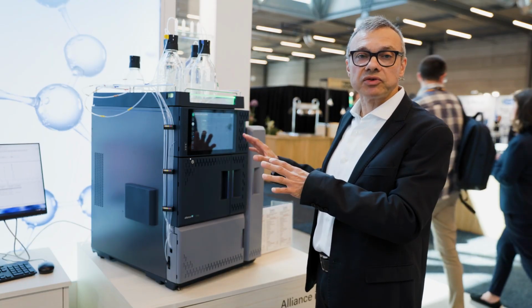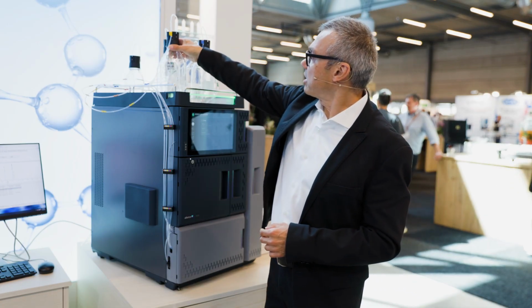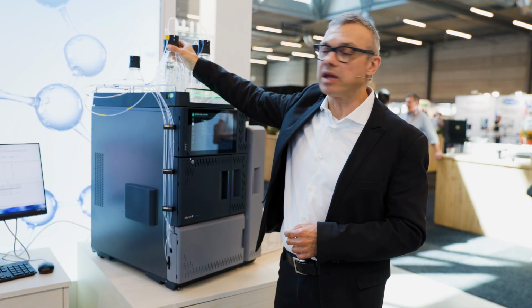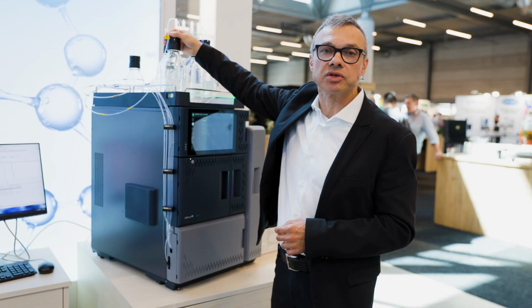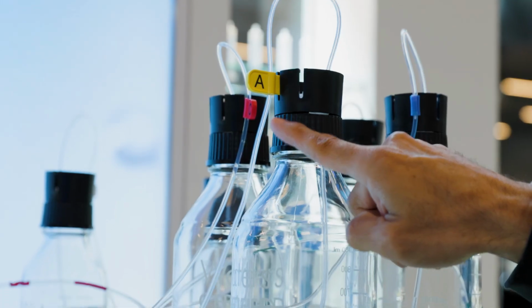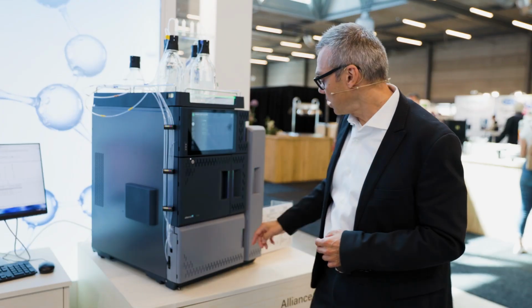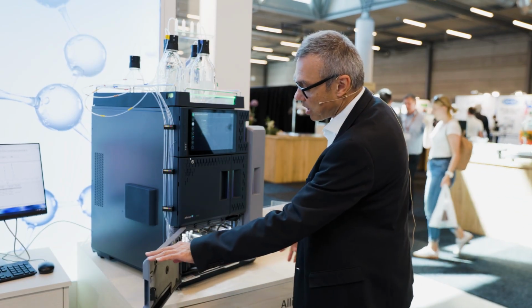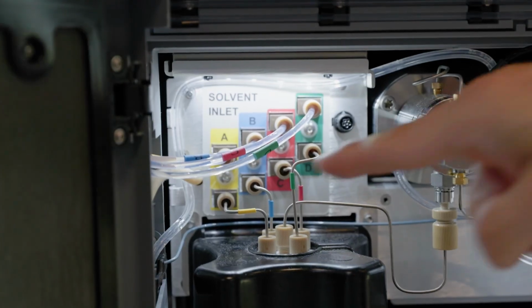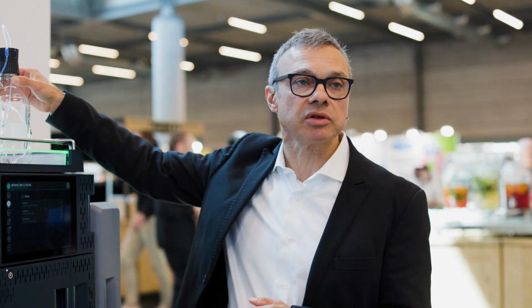Then, when I'm ready to start, of course I would prime my solvents, but I can position my mobile phase in a way that I would easily recognize which lines go where. So if I'm using A and B, for example, I can follow the lines on the side of the system and confirm that no bubbles are flowing through the lines. If not, I can repeat the priming, and I can also check that no bubbles are present in the gradient proportioning valve in the pump. This helps me avoid a common error of placing the wrong bottle on the wrong line.